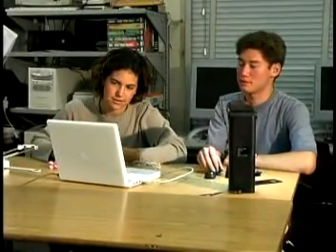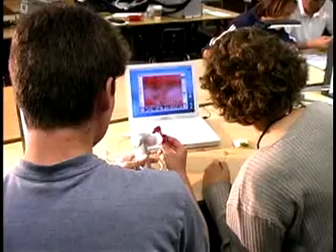Handheld allows you flexibility. It allows you to move around. It allows the students to be a little bit more creative. What I do is I tell the students always start out with low power. Start out with a 50x lens. We can see more and we can see generally.